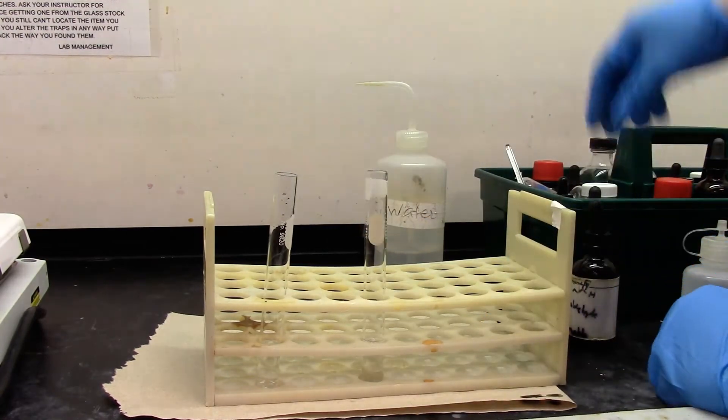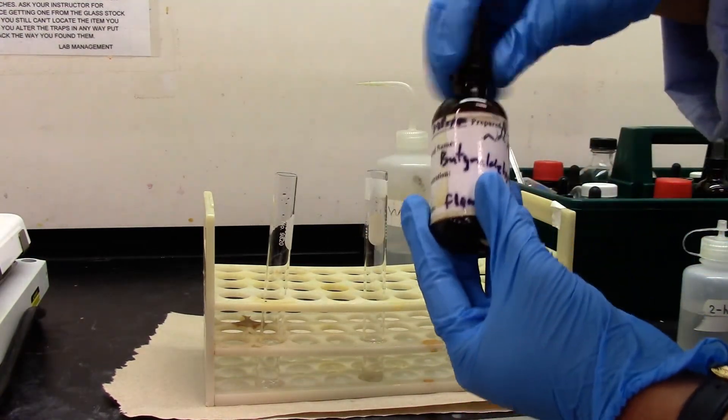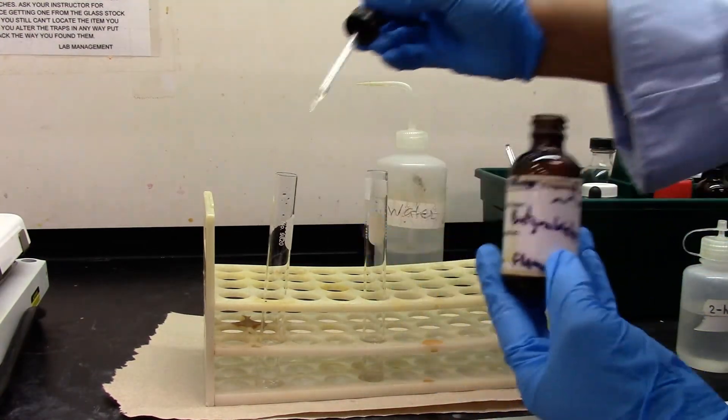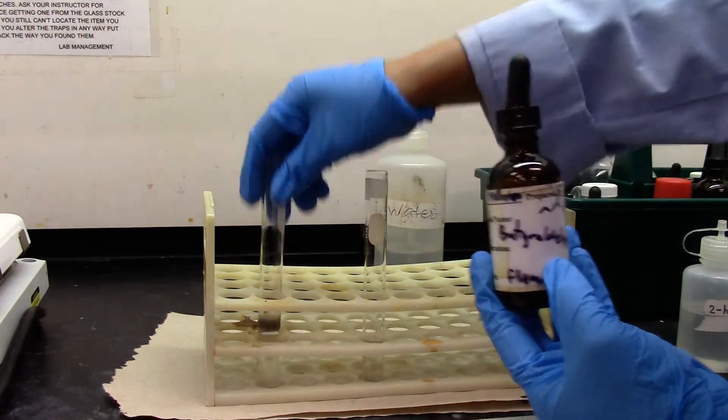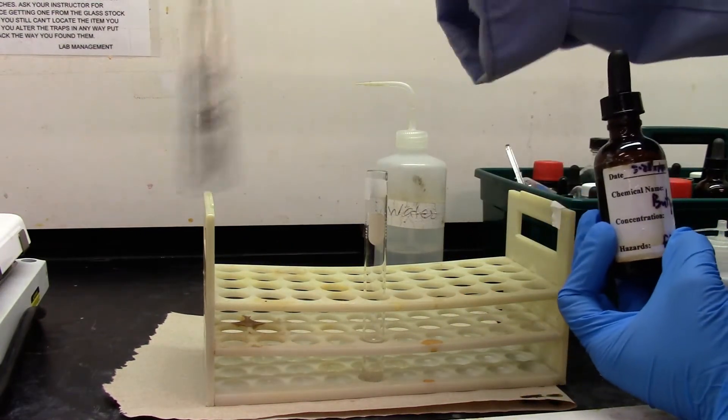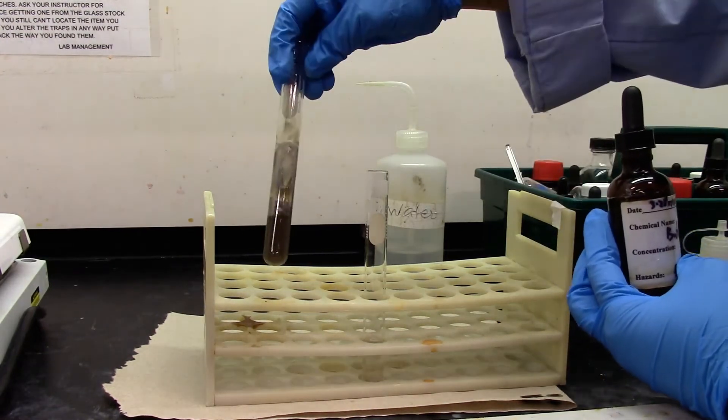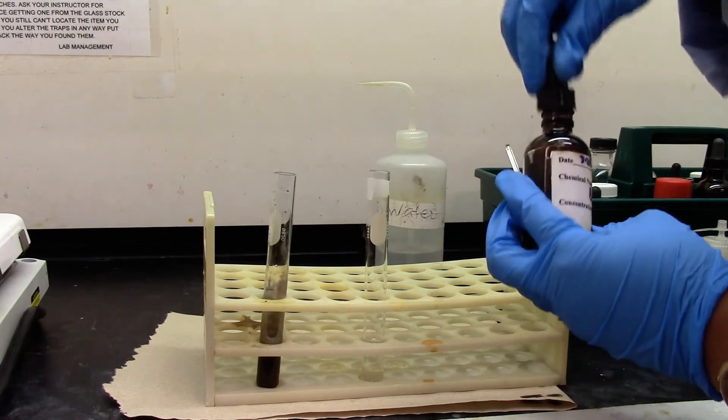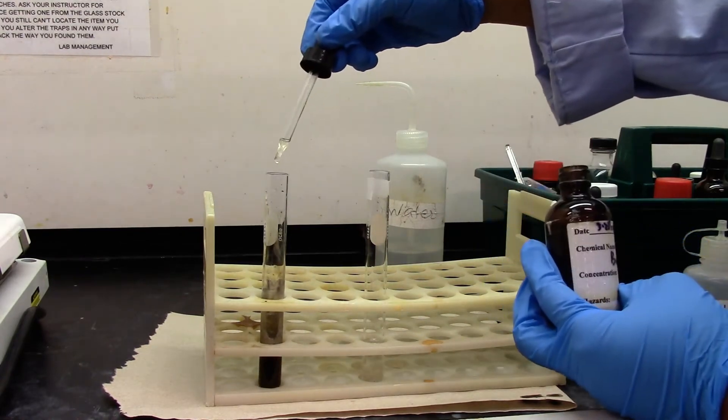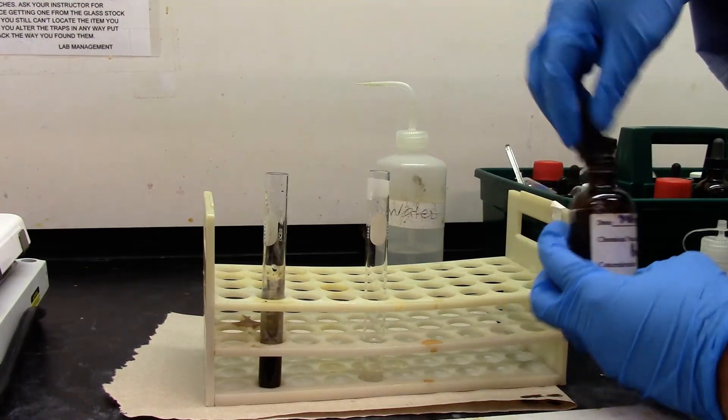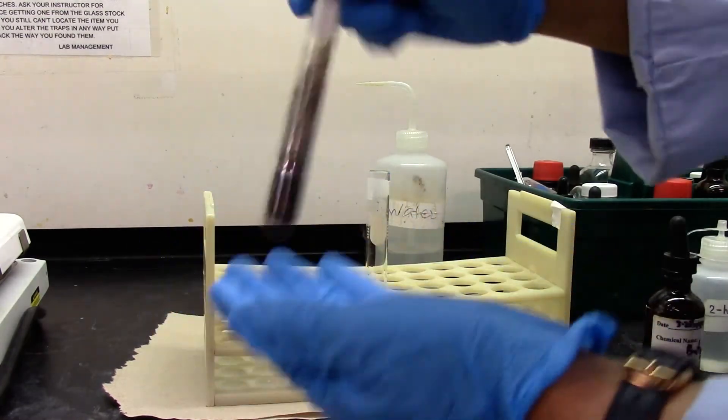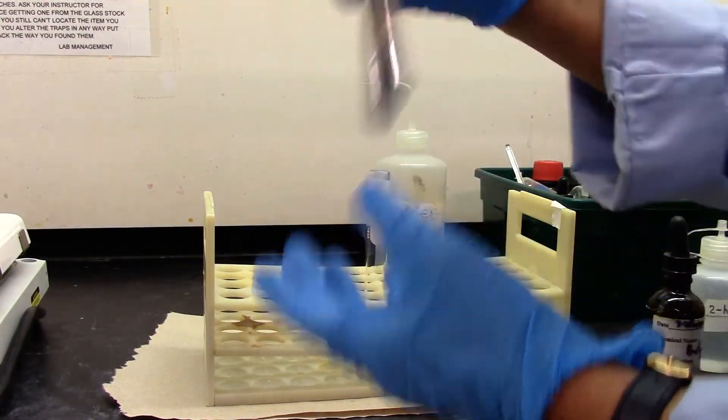As you see this is dissolved, and I am going to add my reagent. Butyraldehyde is my aldehyde. I just added to my sample. I'm going to add a few more drops. I added two drops, another two drops. A silver mirror on my positive test.